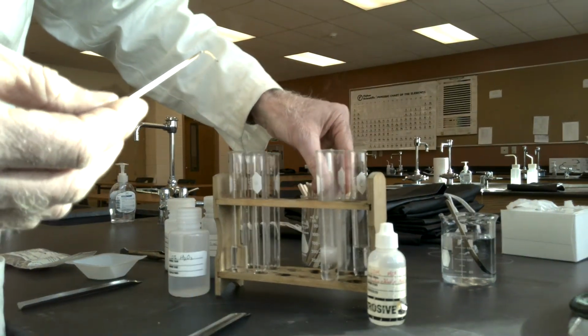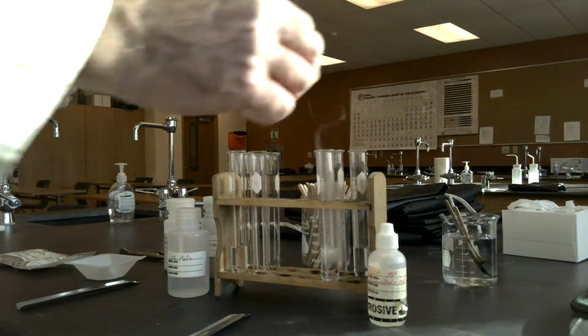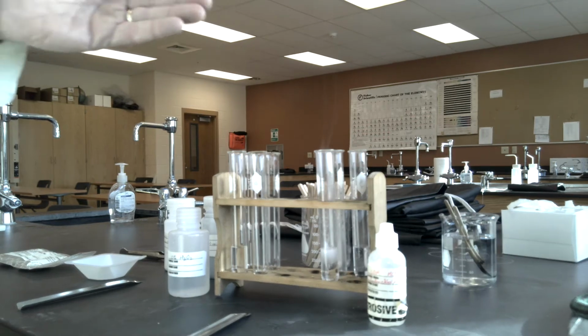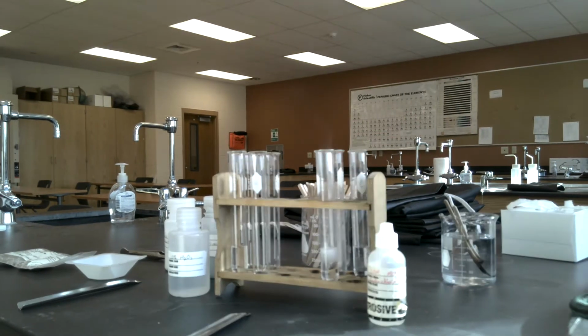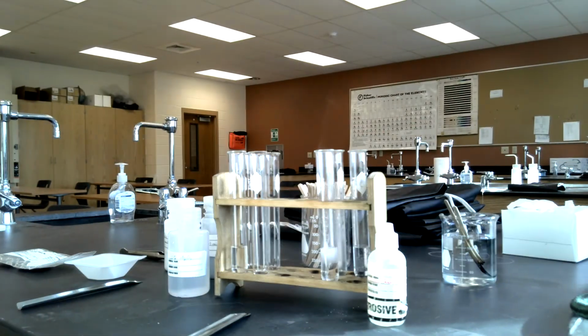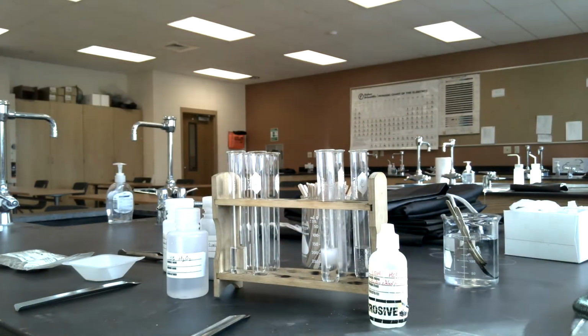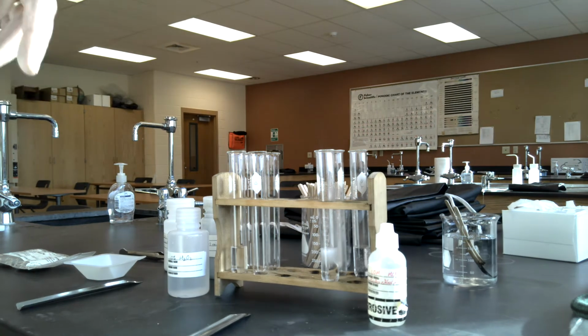that hydrogen. So hydrogen gas can be tested with a flame. Hydrogen in the presence of oxygen will burn, combust, which is what you saw in that inverted test tube when I brought the flame near the opening. And hydrogen gas in this test tube extinguished the burning flame because hydrogen itself can't support a flame. It needs oxygen to do that.